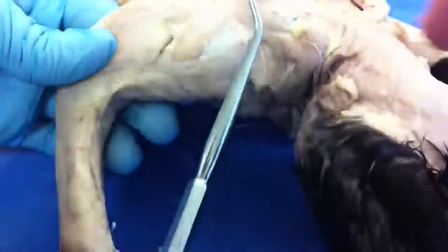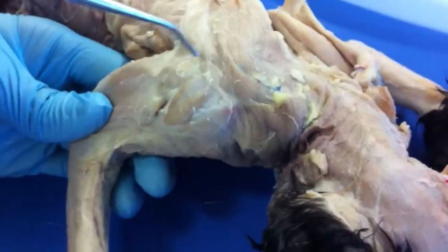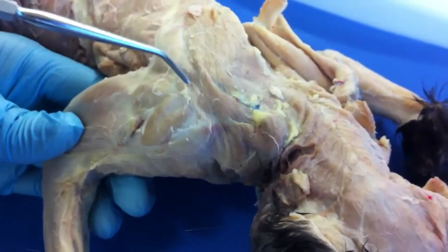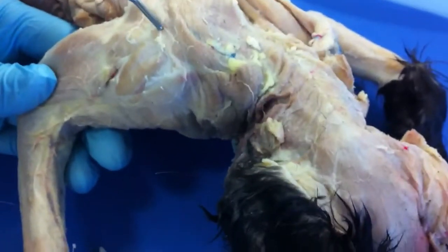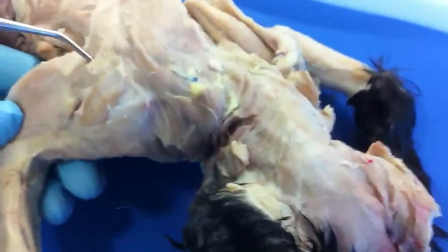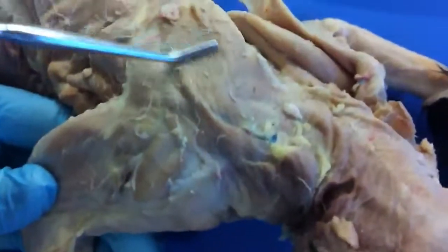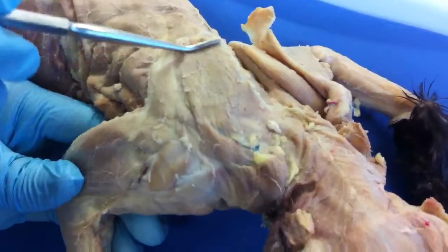The levator scapulae ventralis is that little bump right there. And then just rear to that is the spinodeltoid. The acromiotrapezius is basically all the part above the scapula.